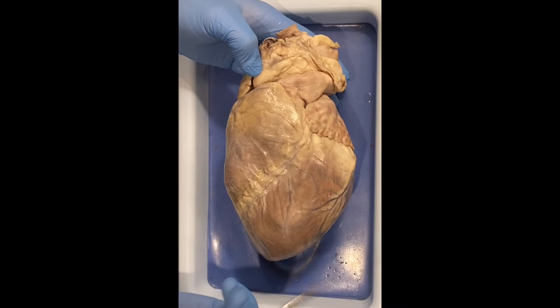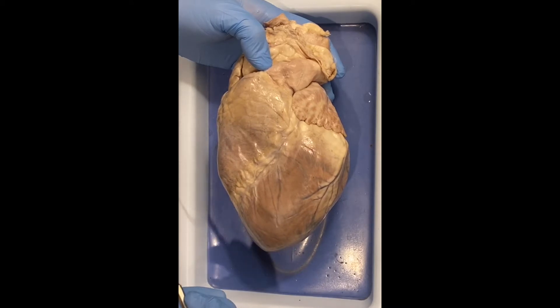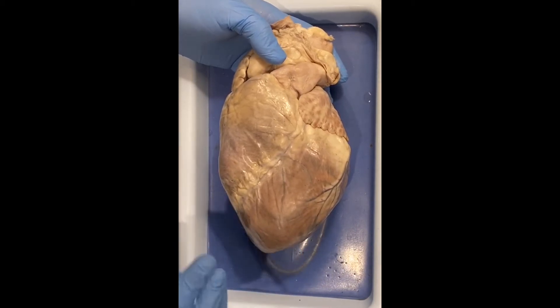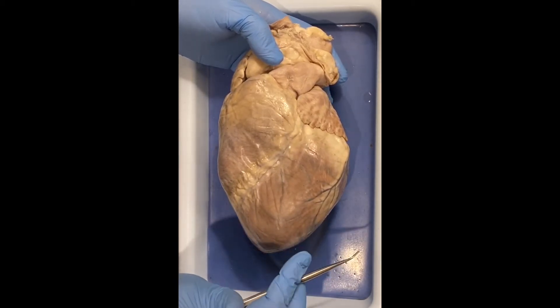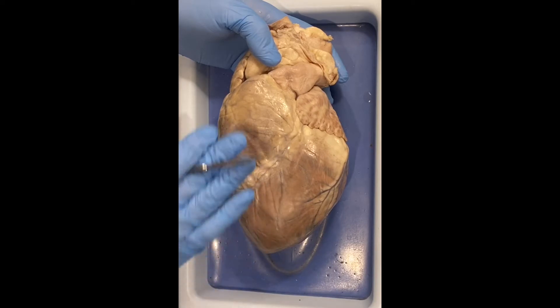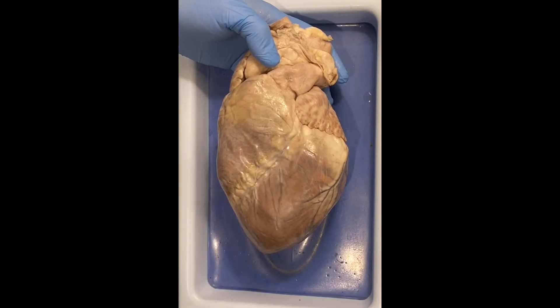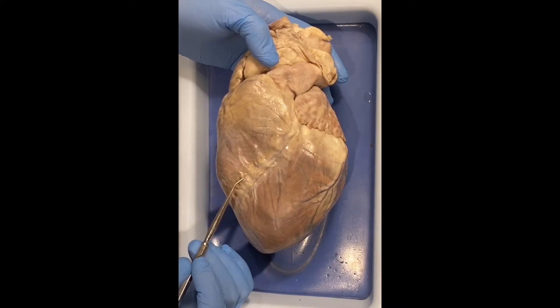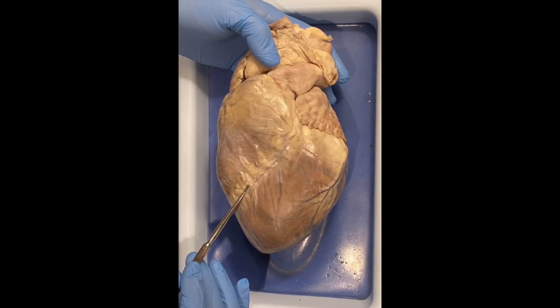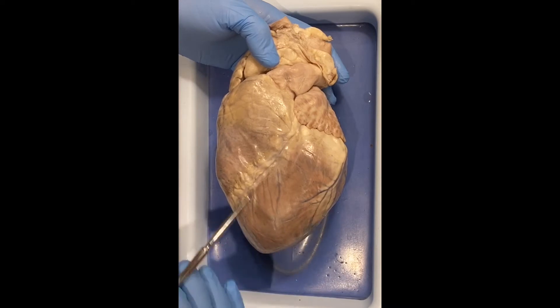From the atria, blood goes into more muscular structures made up of cardiac muscle called ventricles. Think of the heart as a V — the portions closest to that V are the ventricles. There is a right side and a left side of the heart. On the ventral side, you can identify them by this diagonal line called the interventricular groove — 'inter' means between, 'ventricular' refers to ventricles — so this is the separation of the right and left ventricle on the front side.